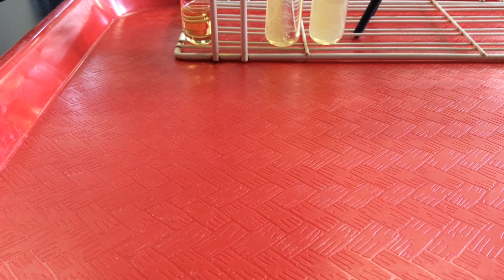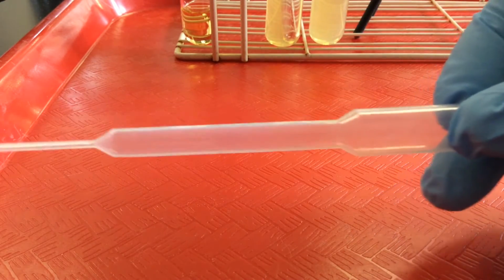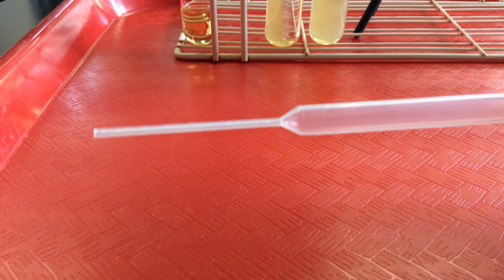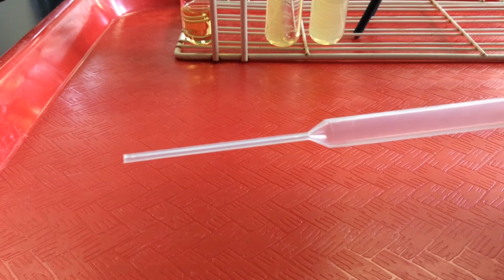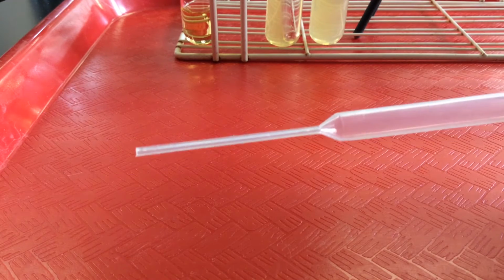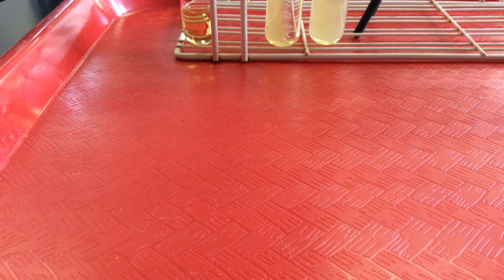Another way that we can transfer microbes is we can use sterile transfer pipettes, or excuse me, these may or may not be sterile. This one is not sterile, but it lets us transfer small volumes of, say, liquid media from one place to another. Or maybe we had pond water, for example, that we wanted to use as a source of microbes. We could use a transfer pipette to transfer small volumes of liquids.